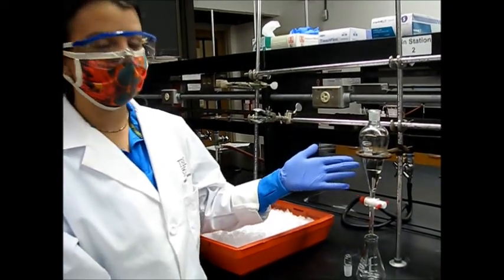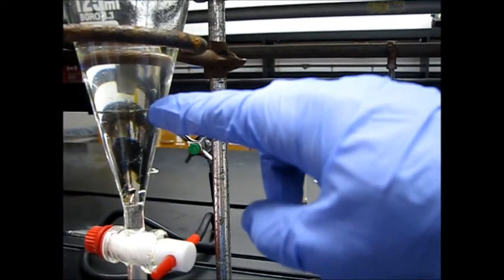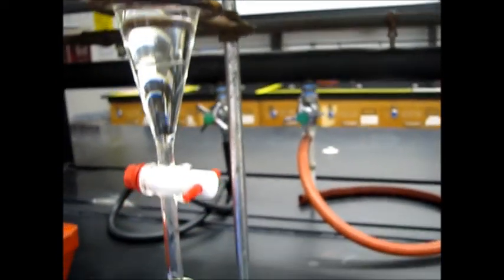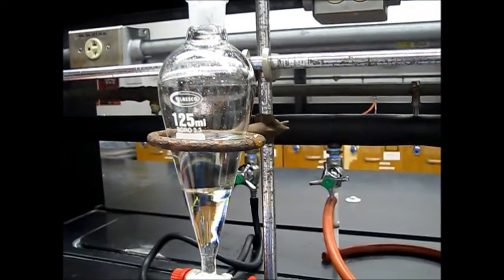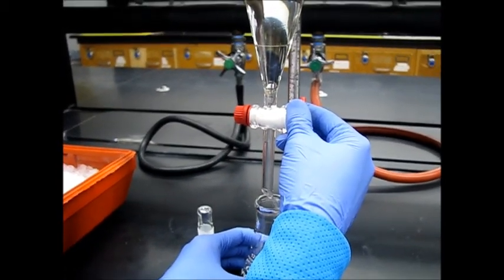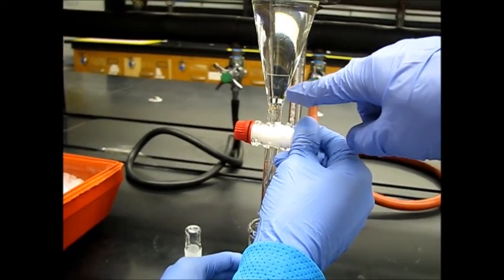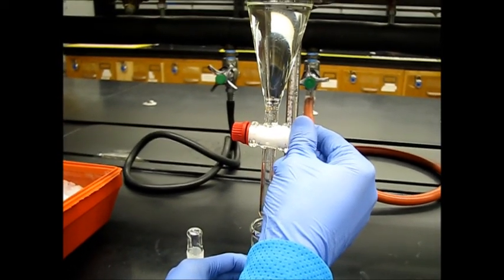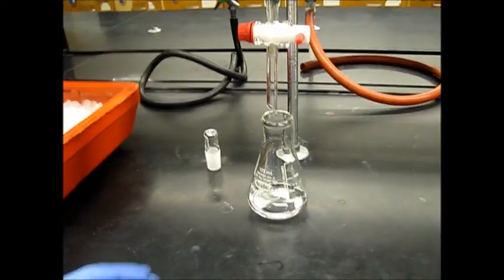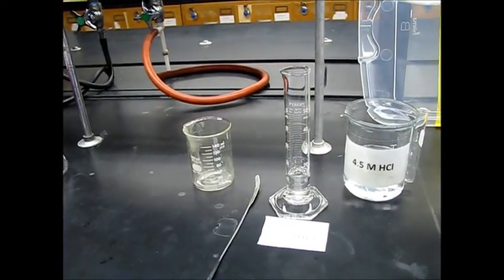Now we can see the two layers have separated and we will be collecting the aqueous layer. The bottom is the aqueous layer and the top is the ether layer. Making sure the separatory funnel is secure, we will open the stopcock gently so that it can collect only the aqueous layer — watch very closely to ensure you stop at the right point. This was the first extraction. Now we will add another 15 milliliters of 4.5 molar HCl and do the process again.